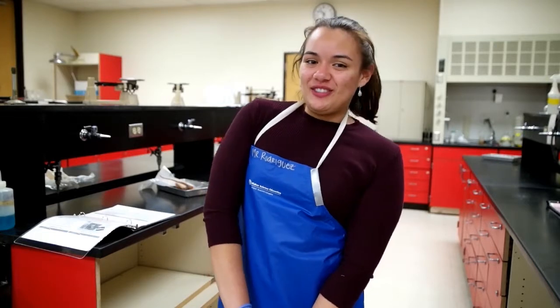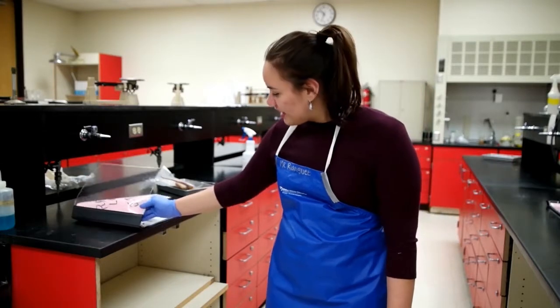We're here today in Mr. Rodriguez's class because we're dissecting a pregnant rat, and we're going to learn how to explore ourselves — like the rat's intestines, figuring out where the babies are. It's an independent learning type of thing because it's Mr. Rodriguez's after school labs. First, you watch the video or read the guideline for how to do it, and then you just follow step by step with the rat.